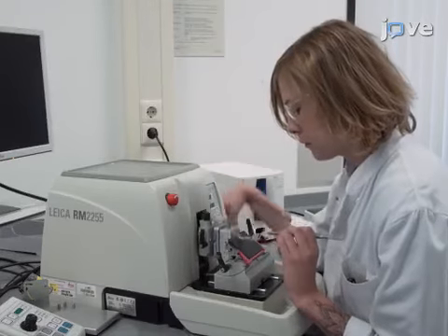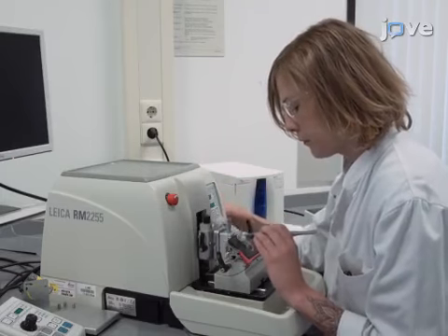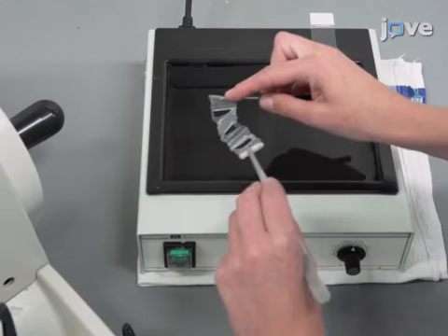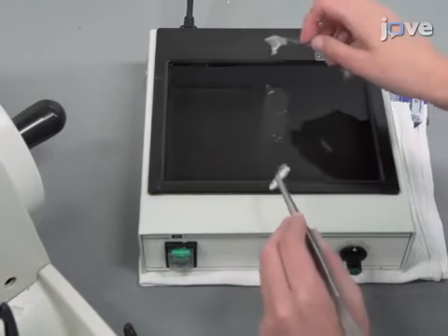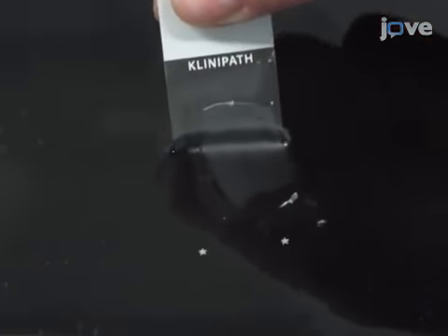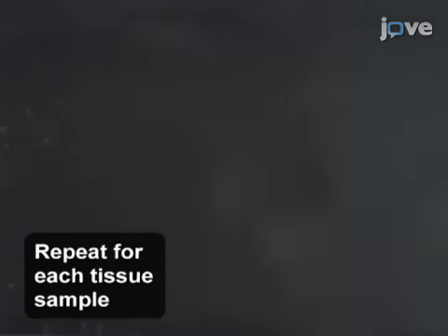Begin by using a microtome to obtain 4 micrometer thick formalin-fixed paraffin-embedded tissue sections, laying the tissue ribbons on the surface of a 45°C deionized water bath as they are acquired. To capture the sections, place a glass slide in the water directly underneath the tissue sample and carefully move the slide up at an angle. The section will stick to the glass surface as the slide is lifted out of the water.